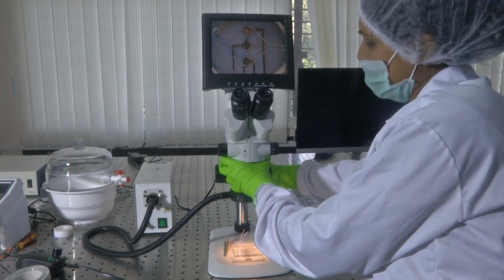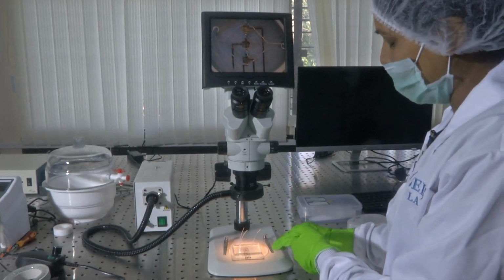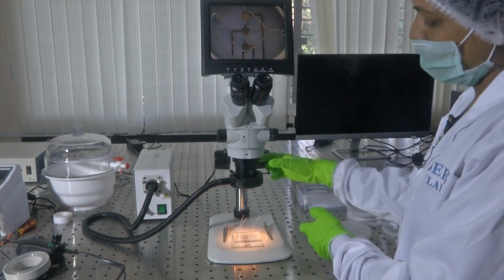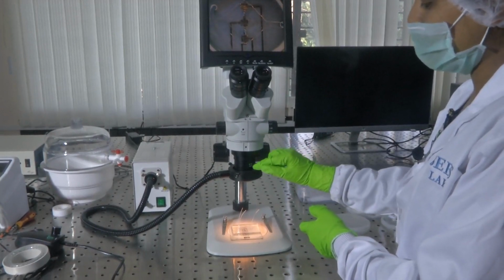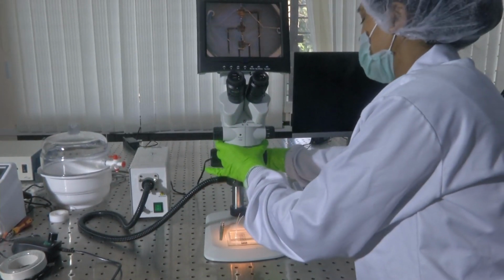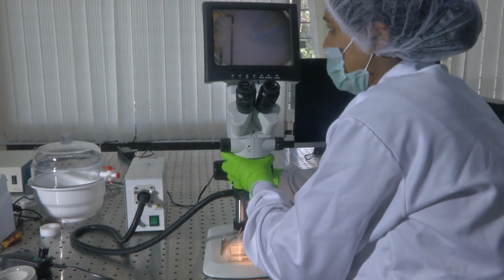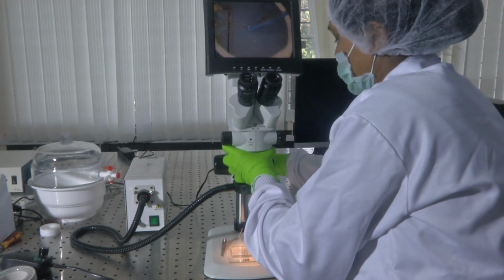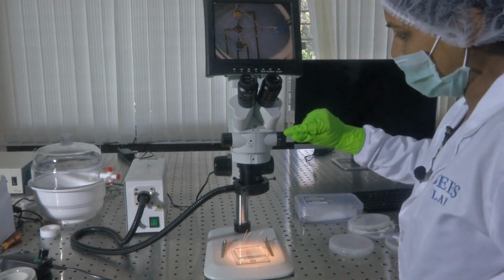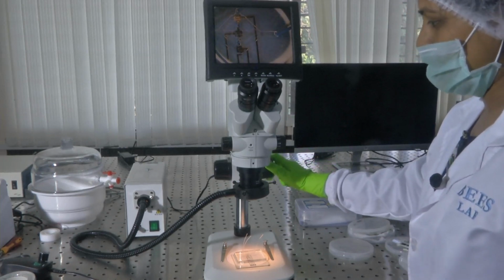Say I hold this and there is something called the working distance, the distance between your objective lens and the sample. You have to maintain the minimum distance which has been mentioned on the microscope you would be using. Here there is a specification of the working distance. Say I want to change my working distance, I would like to move the scope. There is another knob provided here. This is how you can alter your working distance. Let us say I fix it to this. This is how you can change your distance, and then you could alter your magnification using this knob, and you could do the tuning, focusing using this.